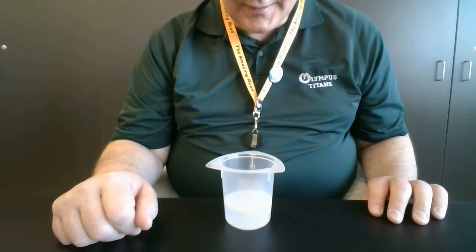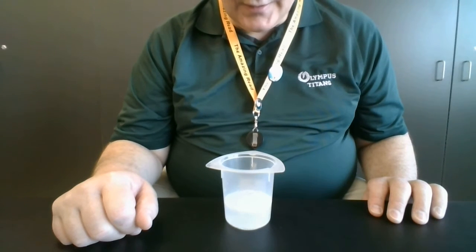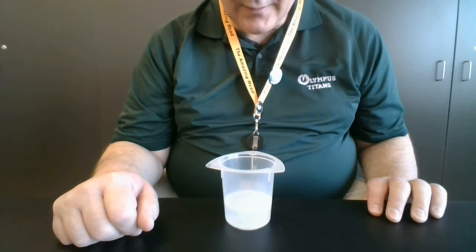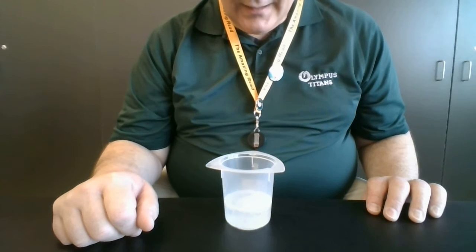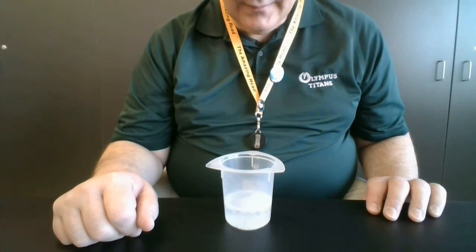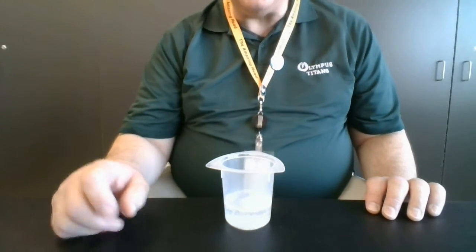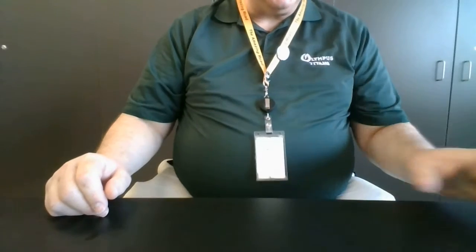Still bubbling a little bit. The other thing we're not going to do is shake or otherwise agitate the container. I'm just going to let it sit until it's done. I see no more large chunks. We'll call that done. So stop timing. Okay, there we go. That's one trial.